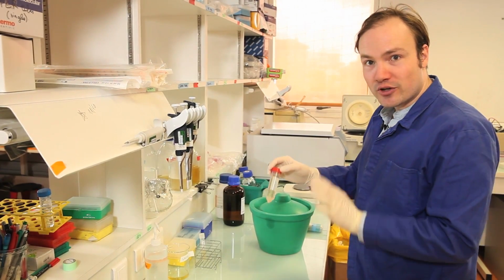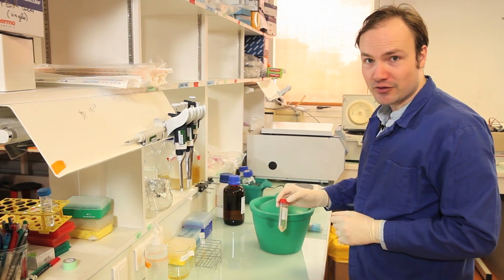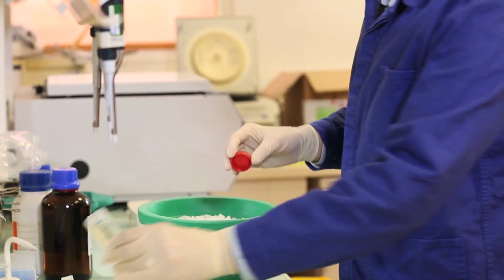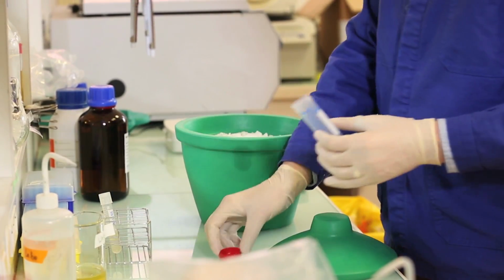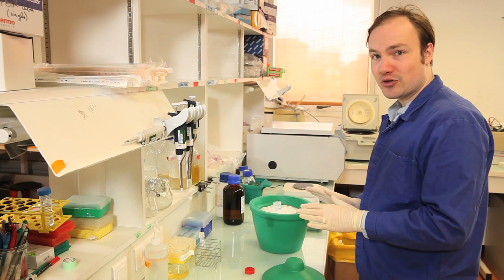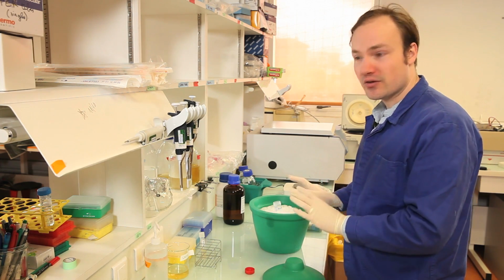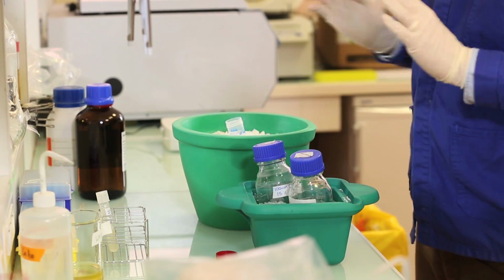Okay, so now we've collected our pelleted cells. Let's turn them into competent cells by adding calcium chloride solution. So the first thing that I'm going to do is very quickly pour off the supernatant from this centrifugation. Store these cells immediately on ice. So from now on, everything that touches these cells should be at 4 degrees Celsius or colder. Now, we're going to resuspend these cells in our calcium chloride solution here, 15 mLs.